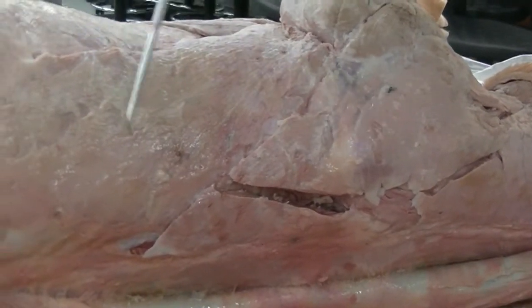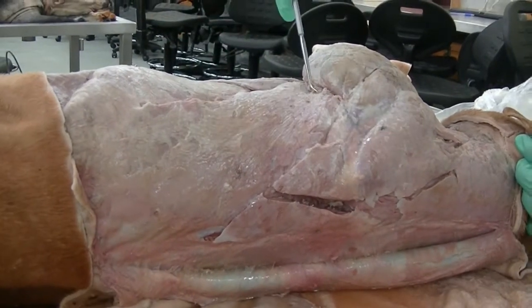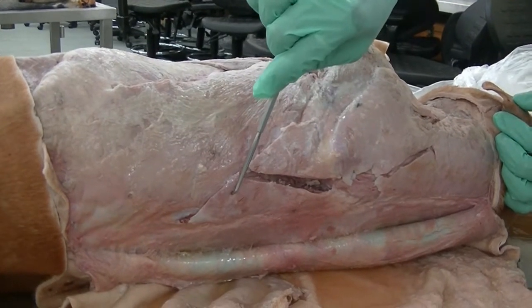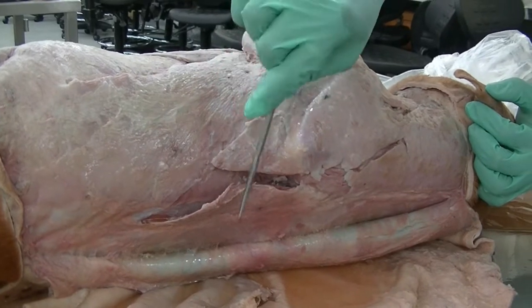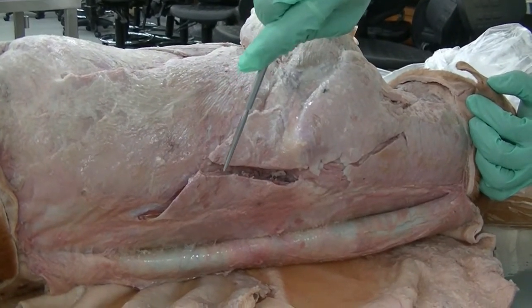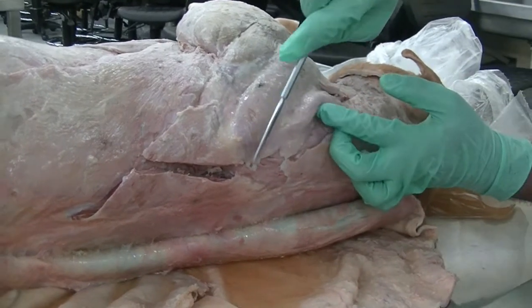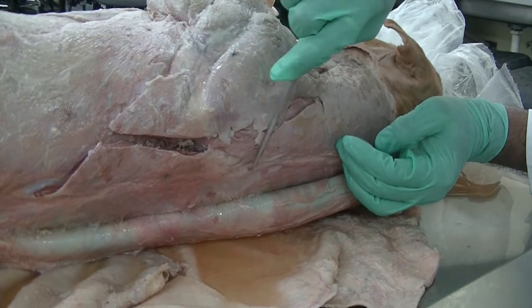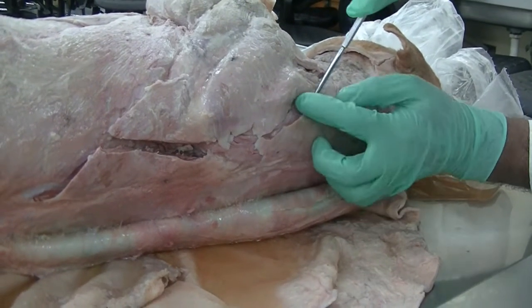Here we see the latissimus dorsi, muscle extending from the thoracolumbar fascia towards the humerus, a triangular large muscle. And we see the trapezius, the thoracic portion, which overlaps the latissimus dorsi partially. In this dissection as well, we have transected the trapezius. The cervical portion of the trapezius, which is supposed to be more triangular muscle coming from the dorsal midline of the neck, inserting on the spine of the scapula.